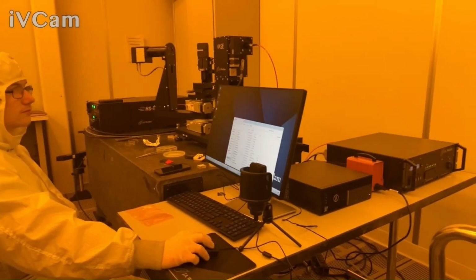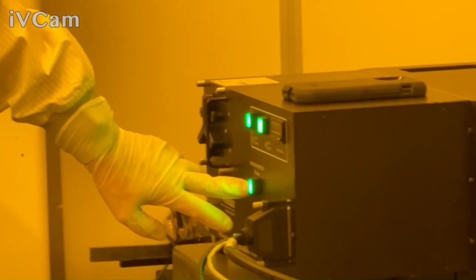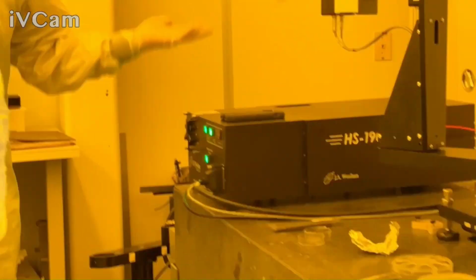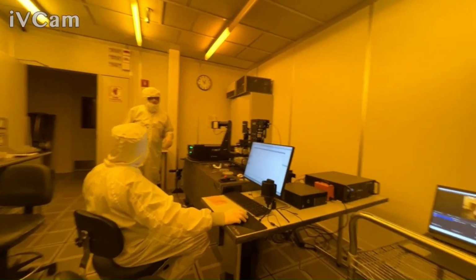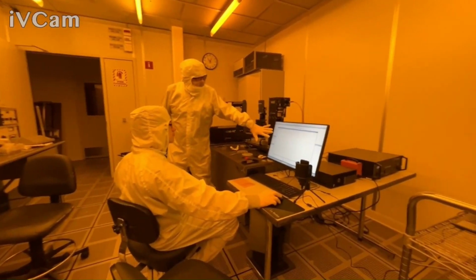So you minimize that. So again, if you had left for the evening and tried to turn the lamp back on, essentially you just need to turn off the power up here, the lamp power. Okay? You can leave this box power on. When you come back in the morning, you turn on the lamp, you light it, wait 15, 20 minutes or so, probably. If you're doing reflection intensity, probably wait at least an hour or more, because that's where you really want stuff stable. But once you start up the software, you'll notice that it says hardware not initialized.